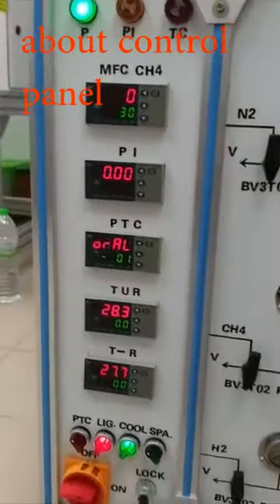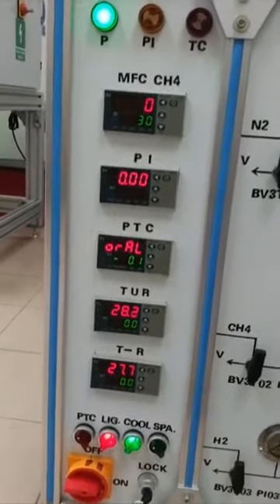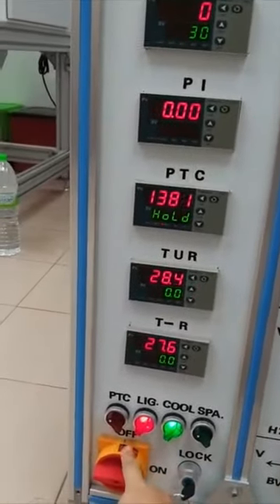The control panel includes all the control meters in this system. When you start your reaction, you can turn on the main valve.